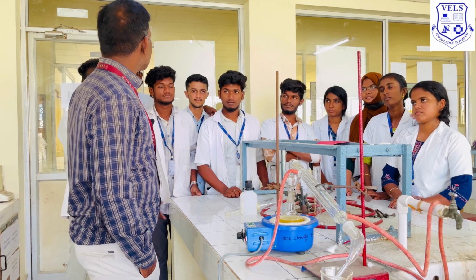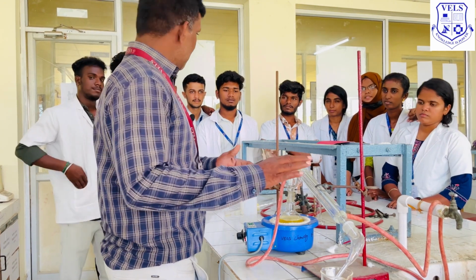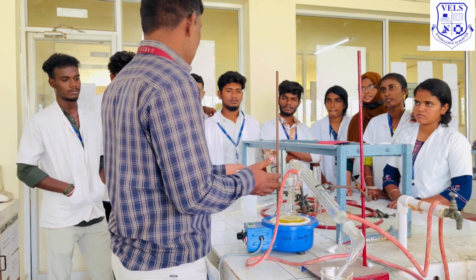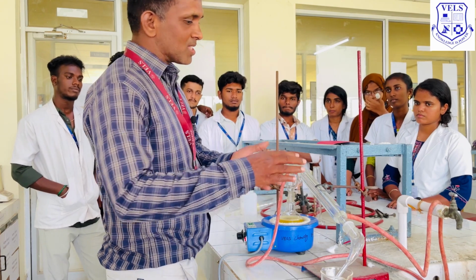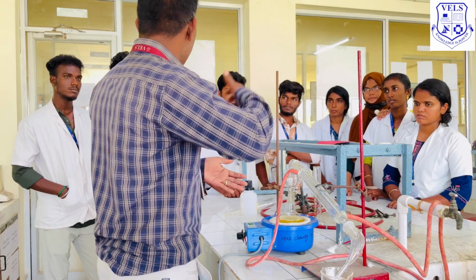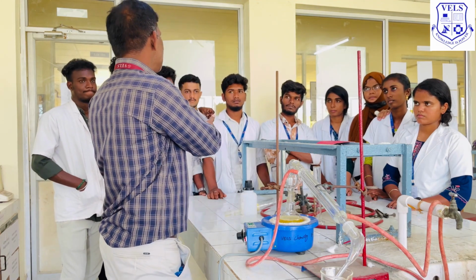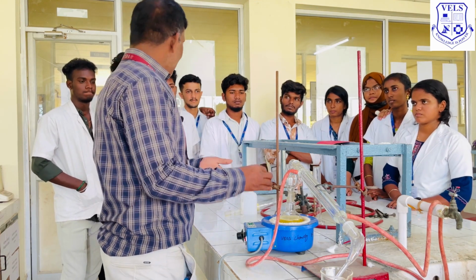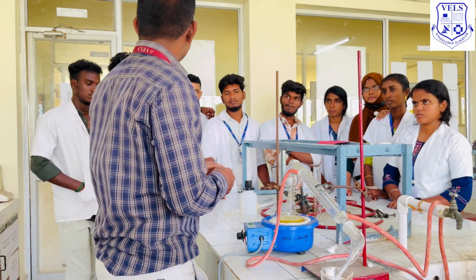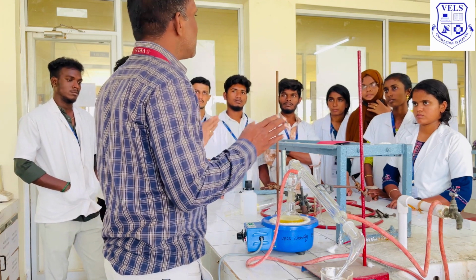After 3 hours of reflux using the methanol solvent, we need to concentrate the methanol solution. Further we will keep it in distillation. You have to remove the maximum amount of methanol solvent. After that you have to prepare the 30% acetic acid solution. You add it, and definitely we will see the precipitate of the hesperidin. Finally, you have to recrystallize using acetic acid to get the pure hesperidin compound.